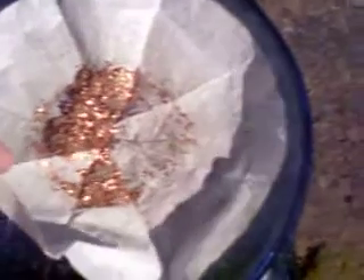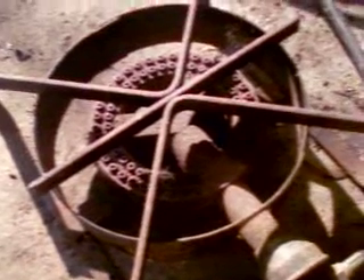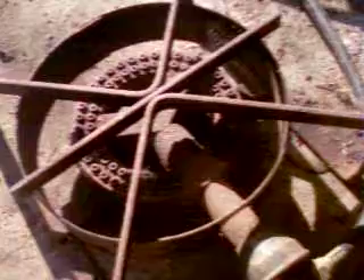Take this, fold it carefully. I am doing this with one hand — this is not the best way, but generally I am not filming what I am doing either. This is the way I incinerate stuff like this. Generally it is done on a little propane burner, something like this with a steel pan. But I am not going to do it that way.